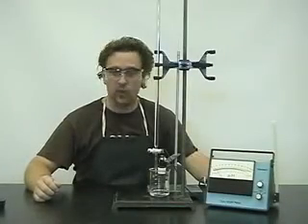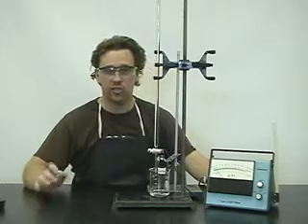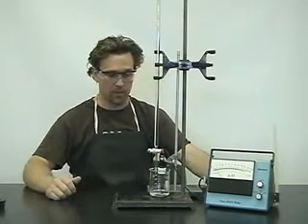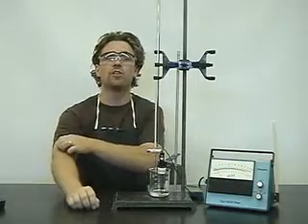In today's little demo, we're going to explore titration curves. There's three types of curves that we're going to explore today.